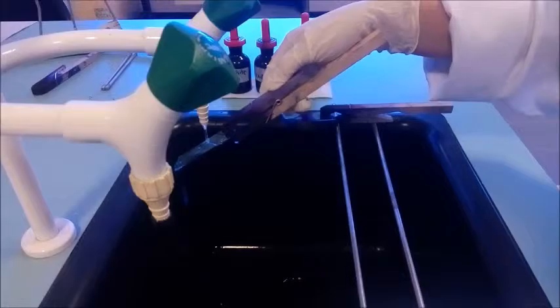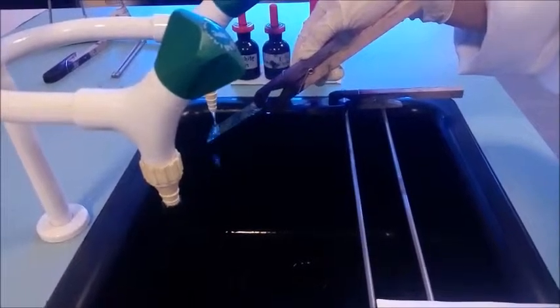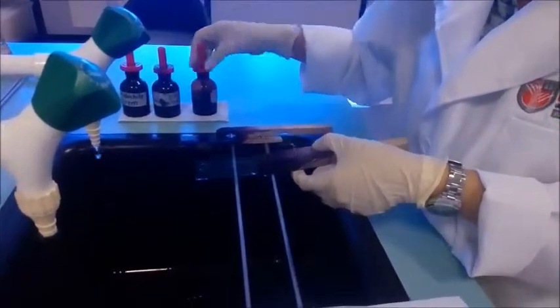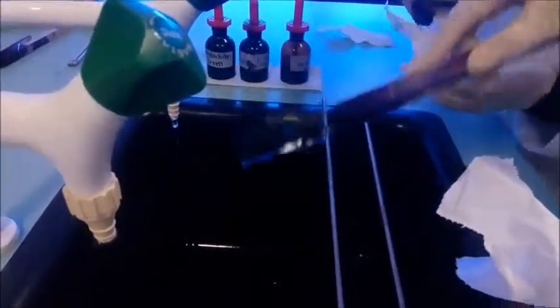And then until the steam does not come out anymore. Next, restain with safranin for around 2 minutes. Wash, blot and dry the slide, and later observe the slide using the 45 or 100 objective lens.